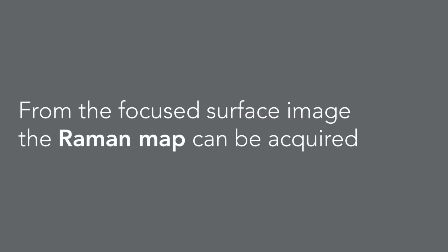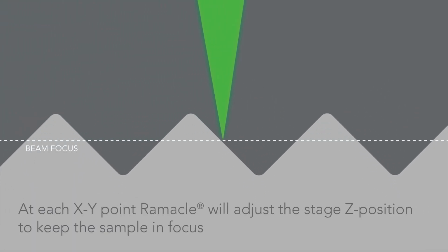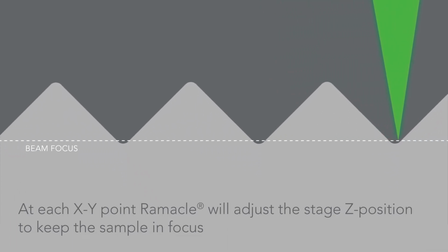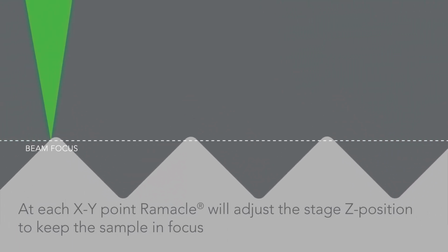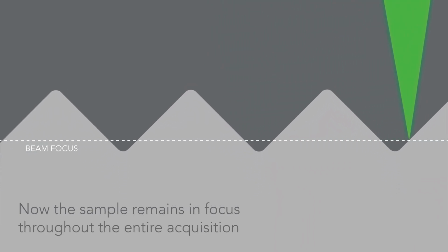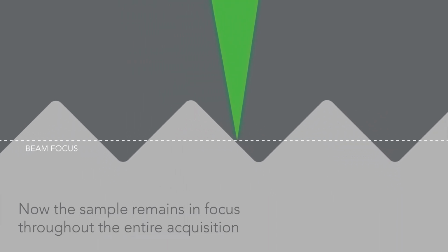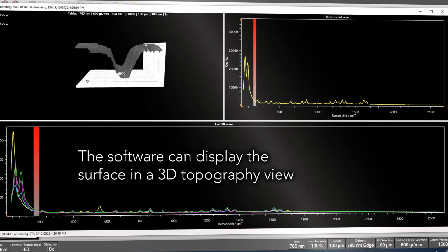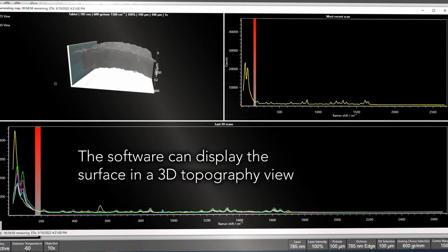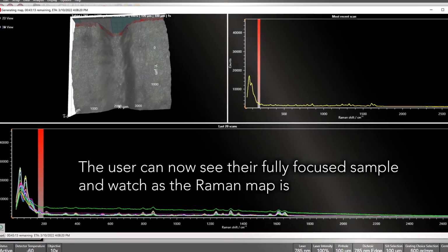We can now move on to step 2, Raman mapping the surface, where the Z values that are needed are known from the surface image that we just built. At each XY map point, Ramacle will adjust the stage Z position, keeping the laser in perfect focus with the sample for the entire measurement. Whilst the map is being acquired, the surface image can be displayed in 2D or 3D, and the user can watch as their map is running.